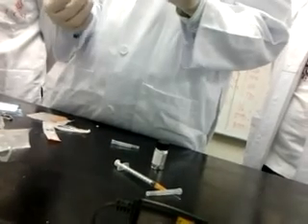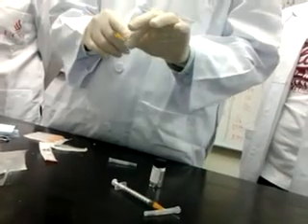You're already out of your skin. That means you open air already. That means you can see all the bubbles inside. That means it's not right. So you remove it again and pierce. Once you pierce it, you hold your needle this way, and this is inside the skin itself.